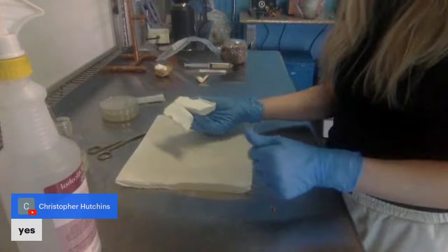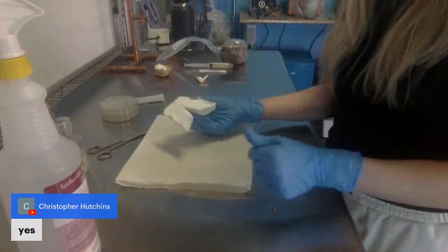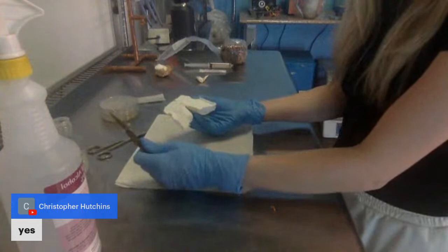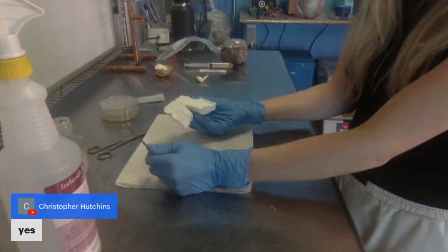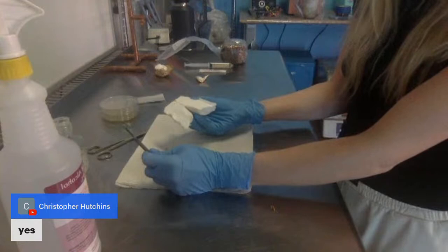So I got your surface sterilized mushroom. Rather than cutting it open because your blade is going to go through it and touch the inside with something, you can bypass touching the inside with something just by ripping it. So what I usually do is rip it open. Now, so far, nothing has made contact with that tissue. Christopher, I would just recommend buying isopropyl alcohol. Yeah, I misspoke. Ethanol, if you use really clean ethanol, it will work, but it's going to be a lot more expensive.